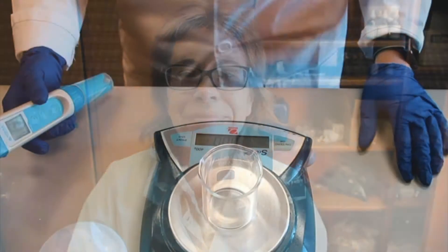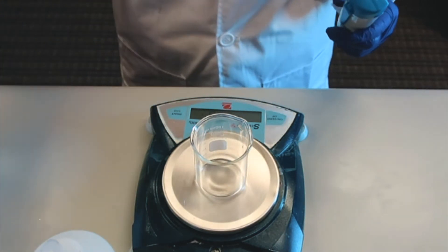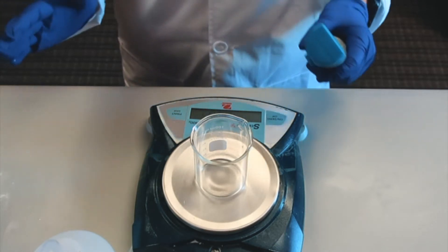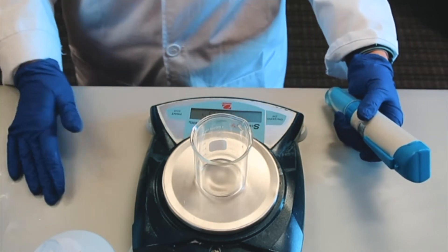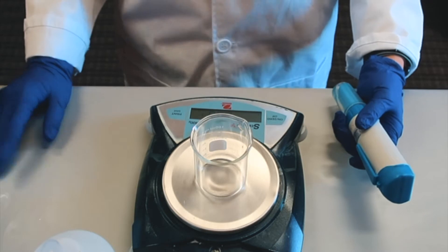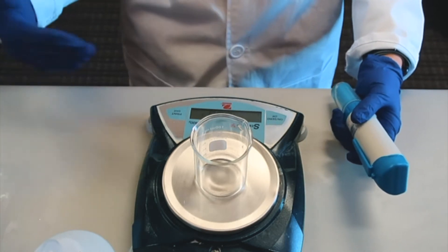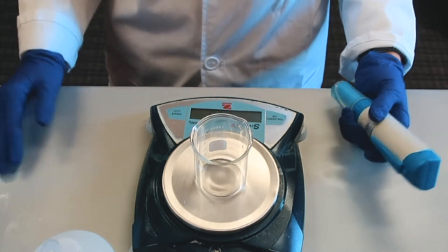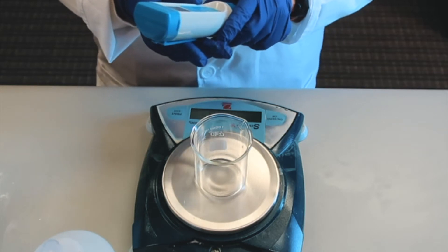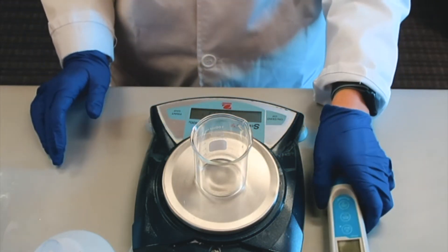Alright, we are ready to measure the pH of a cream. I have my pH meter, I have acids in case I need to lower the pH, and I also have bases to raise the pH. To lower the pH you can use lactic acid or citric acid — personally I prefer lactic acid because it also has some skin benefits besides adjusting the pH. To raise the pH I like to use sodium lactate, a 60% solution, but you can also use triethanolamine.